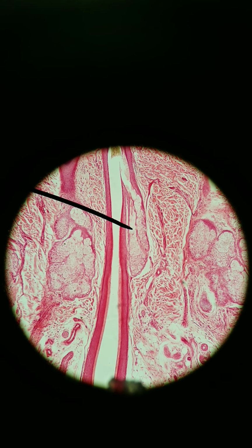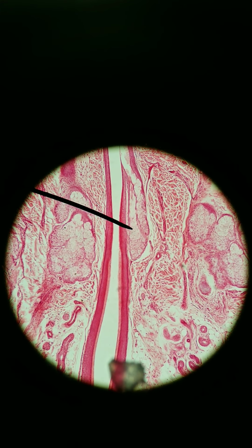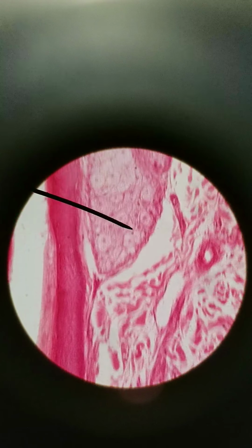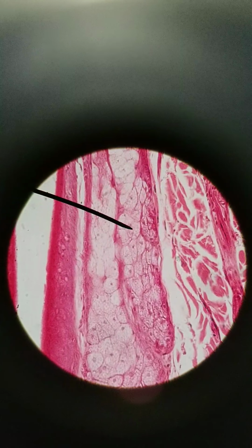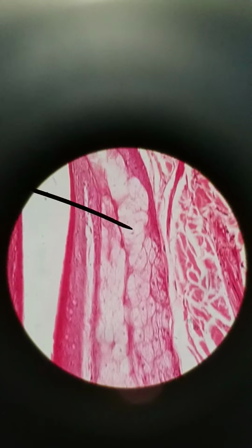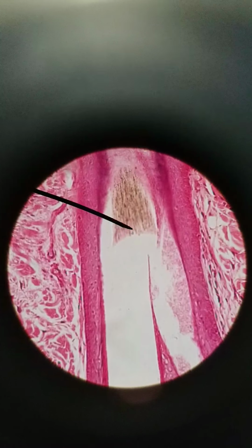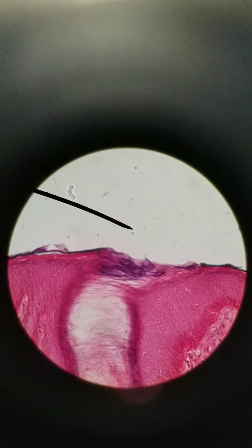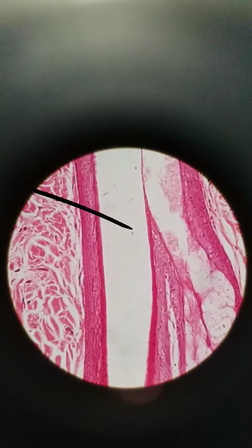So all these grape-like cells, which I'm at 100x right now, I'll go to 400x now. Here, all these light-colored cells, those are sebaceous gland cells, and they secrete out into the hair follicle cavity onto the surface of the skin. Sebum is great for waterproofing and keeping your skin moist because it's so oily.